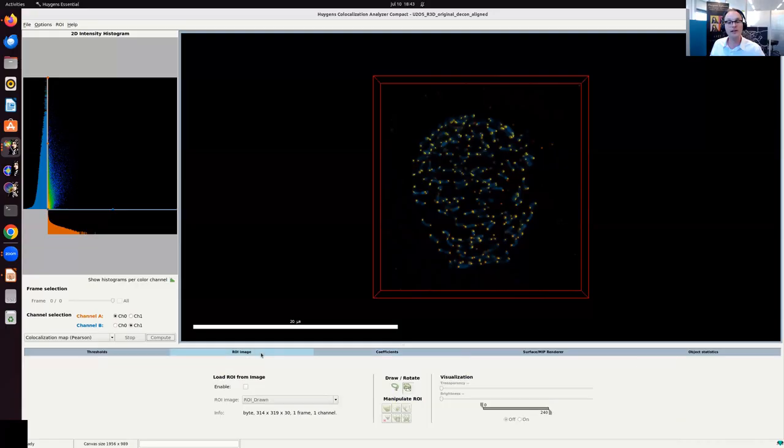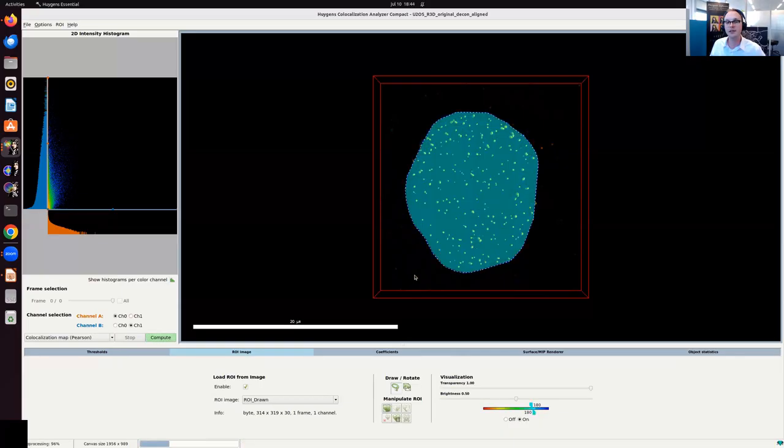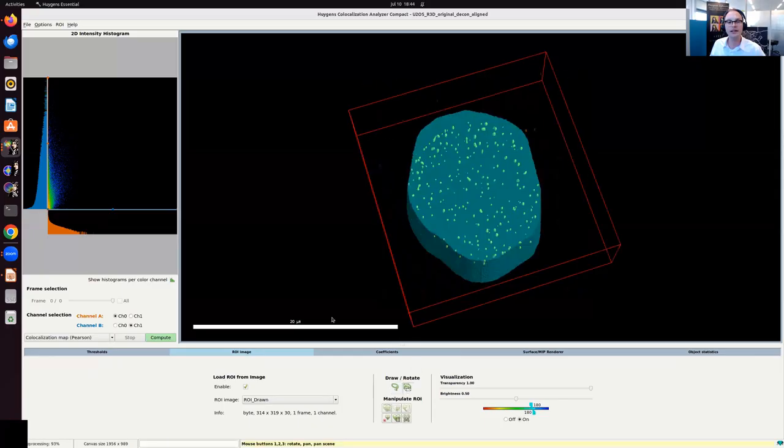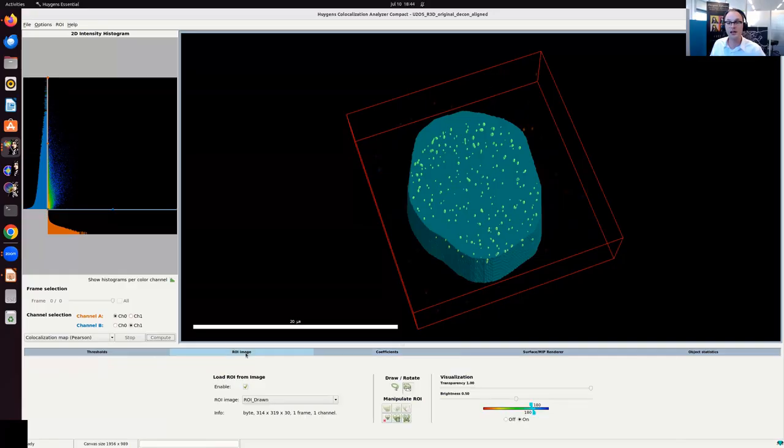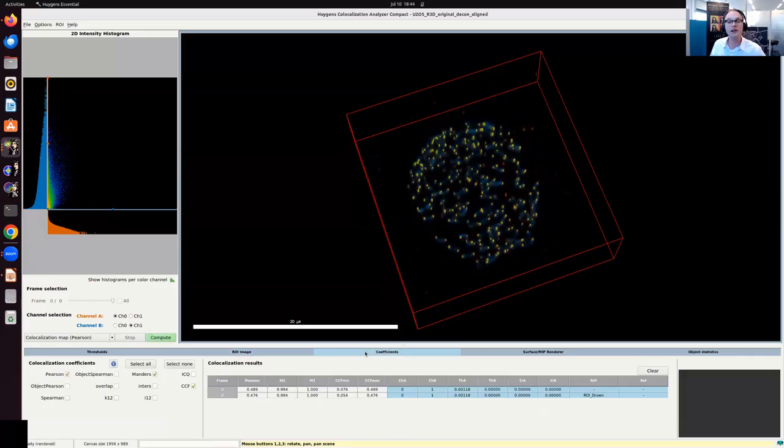Now I can also add a ROI. So if I don't add a ROI, I take the whole image by default. But if I add a ROI, of course, I only have one cell in this image, so I don't really need to add a ROI, but I just show it to you right now. I have added this ROI, and if I hit compute again, then I will just compute it for the area which is inside of my ROI. So it's really easy to do, and you can also load ROIs from an external program if you like. So I'm just going to clear it.